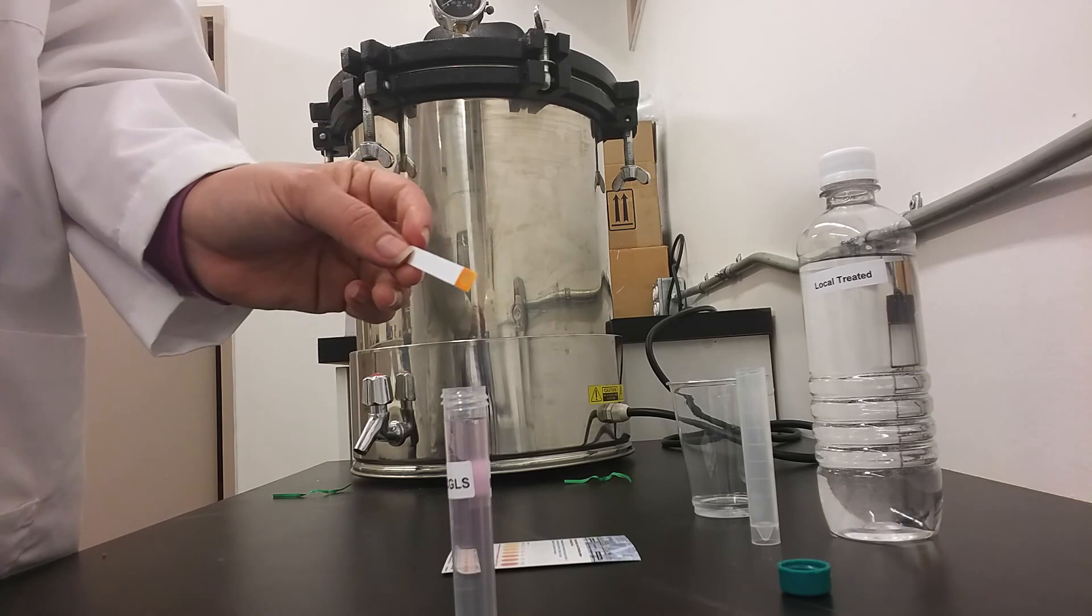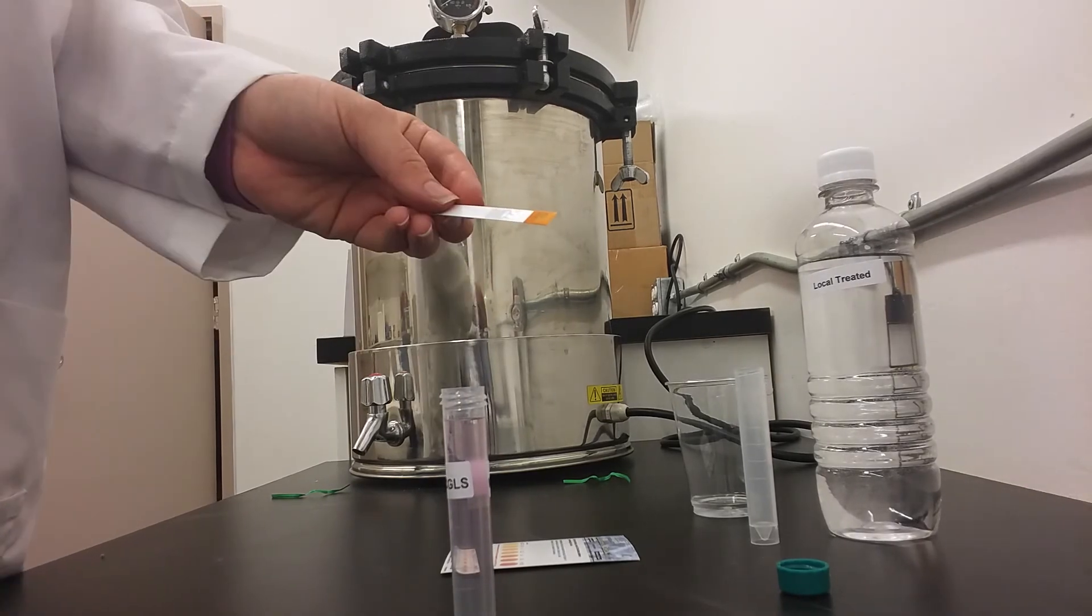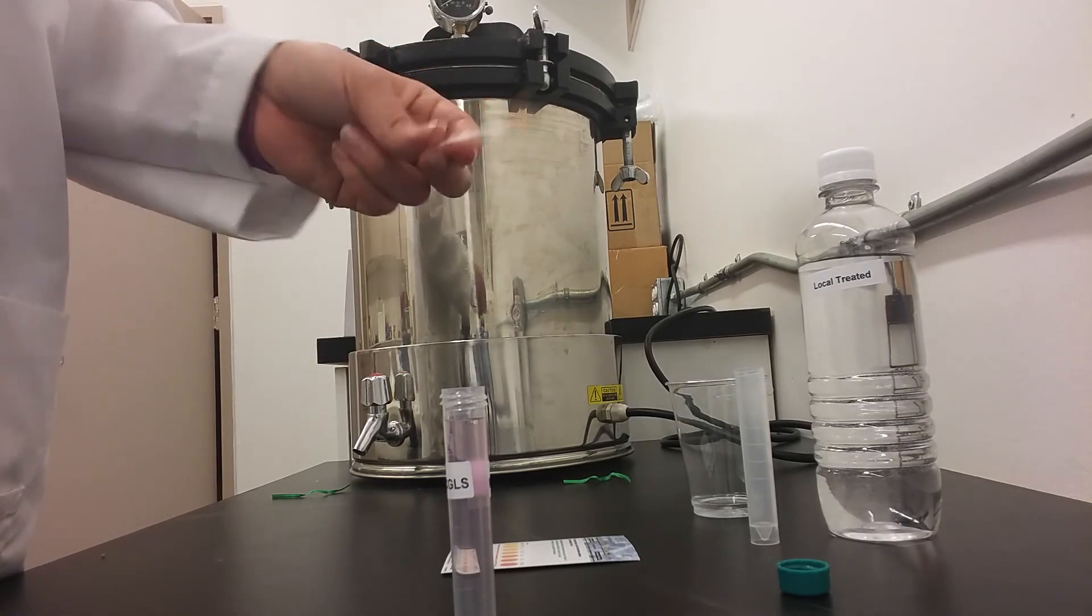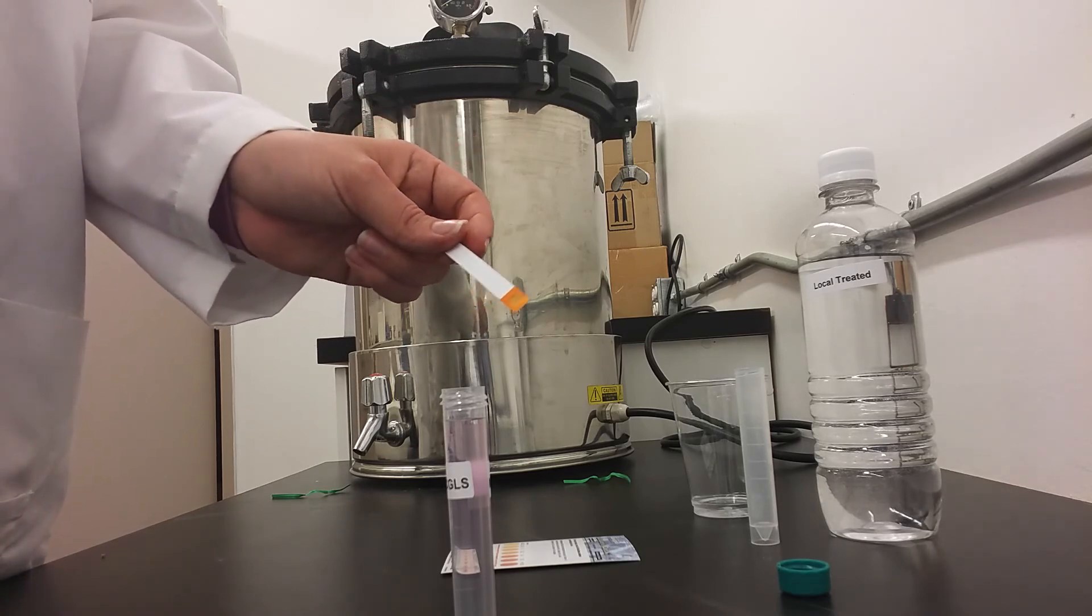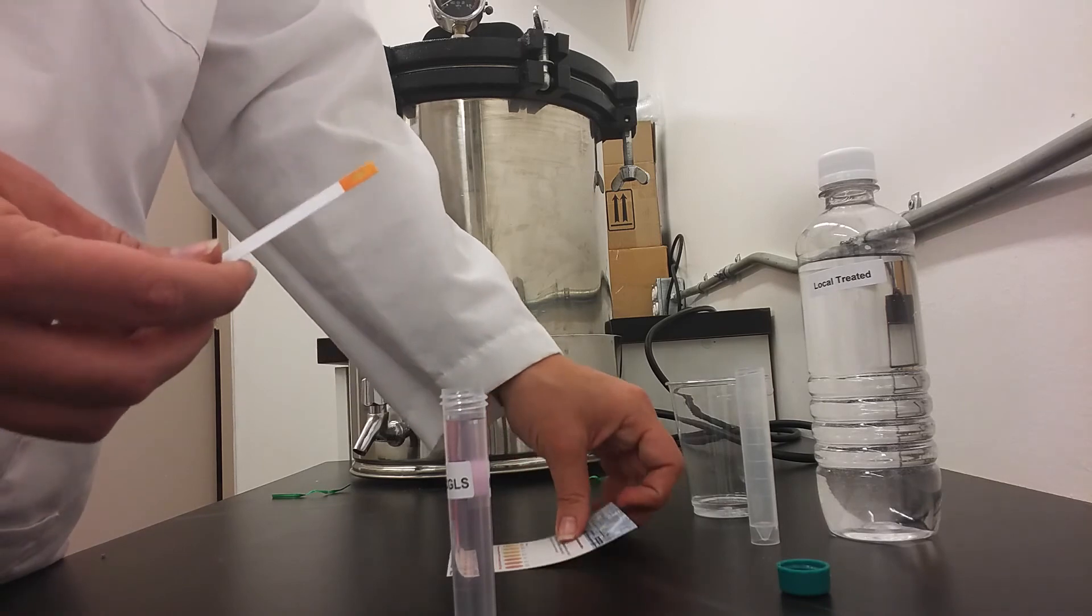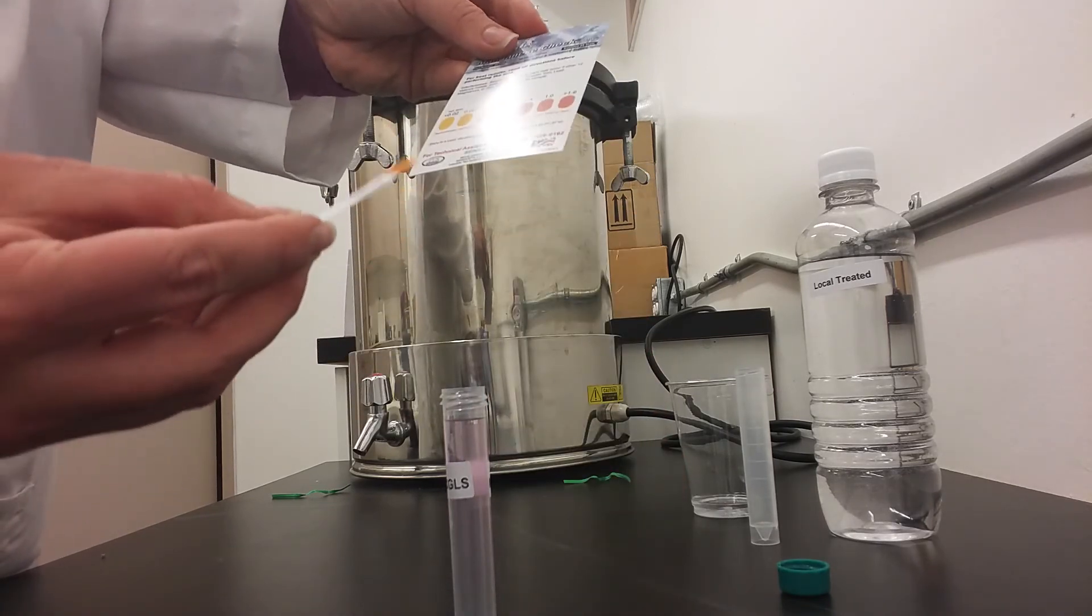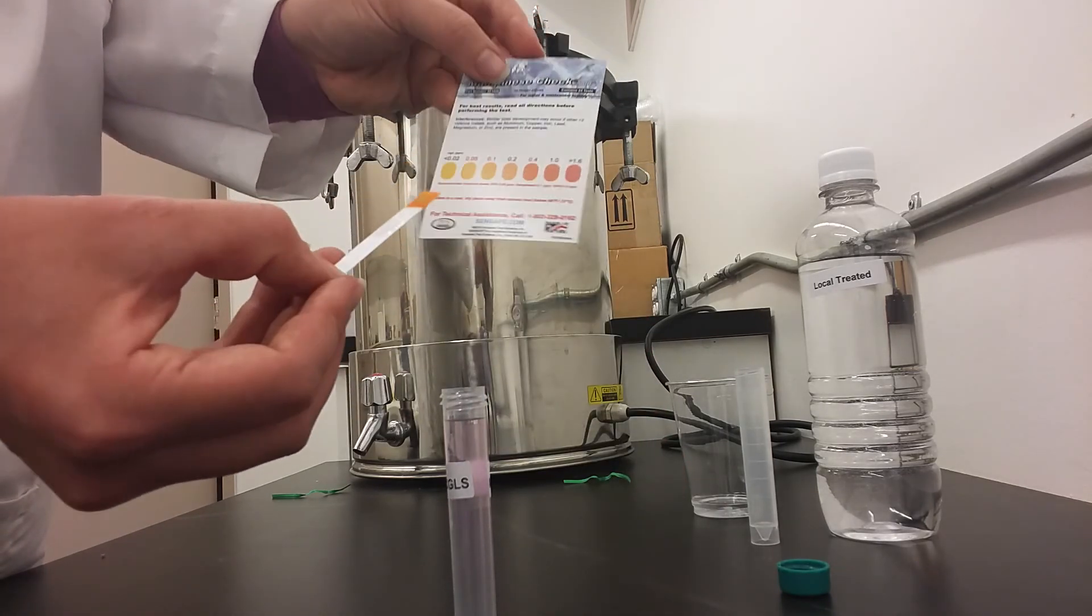Next you will extract the test strip from the water. After waiting 90 seconds and shaking off the test strip to make sure there is no excess water, you will compare the test strip to the chart included and match it to the closest colored dot.